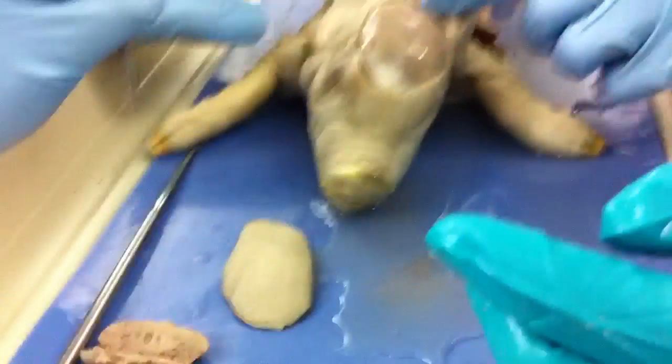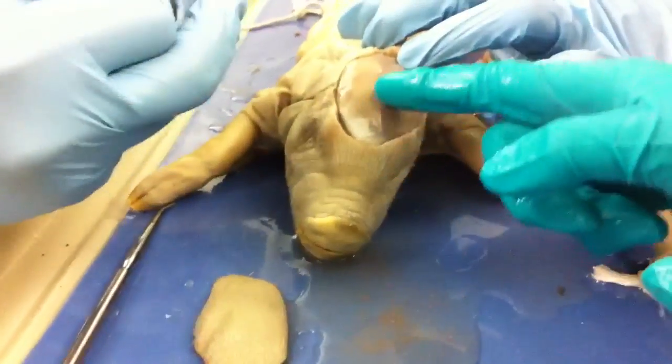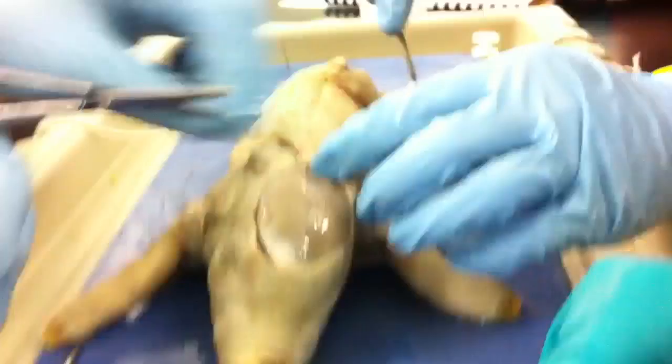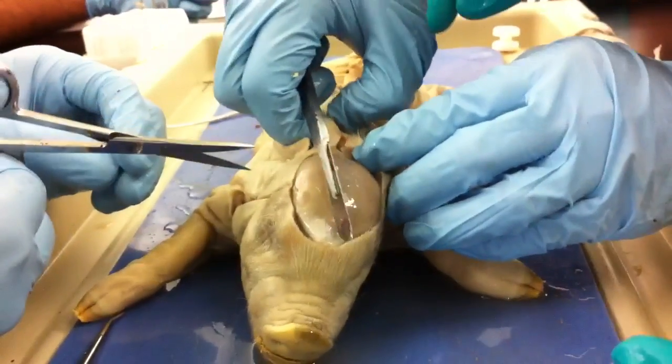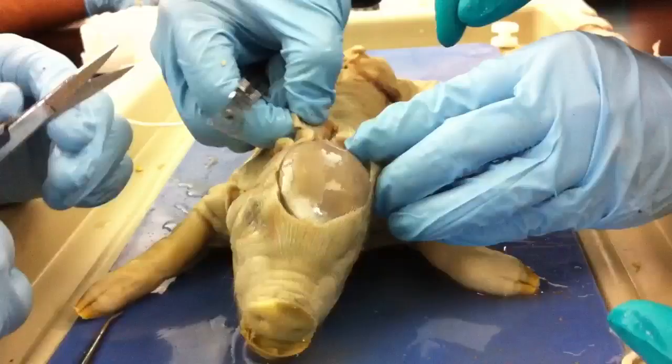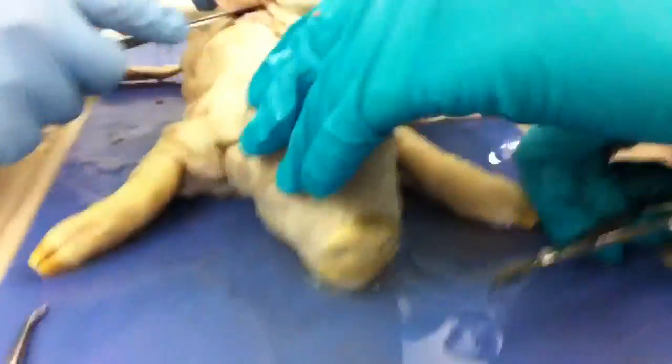Okay, I'm not going to wear this jacket. What is that right there? That's the skull, man. Be careful. It's juicy. Okay, are you going to cut this? Dude, be careful, man. You have the scalpel — you might mess yourself up. Like the skull? Dude, you poked his brain. I'm sorry.